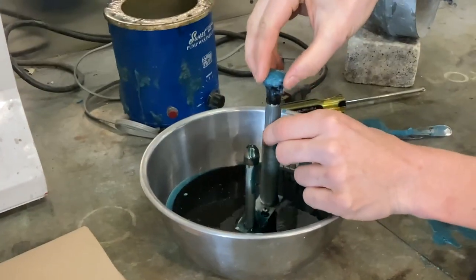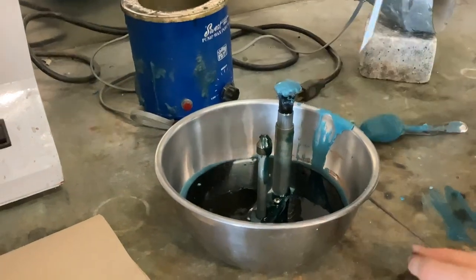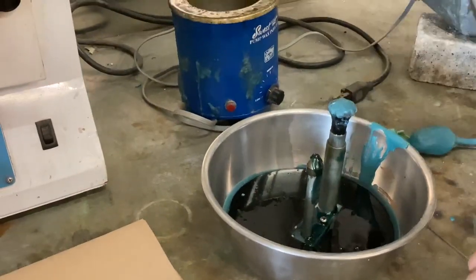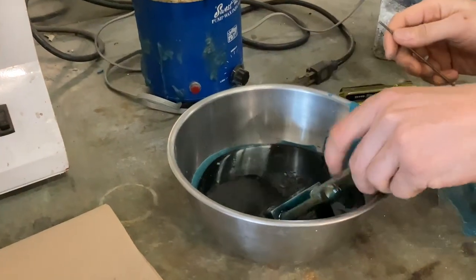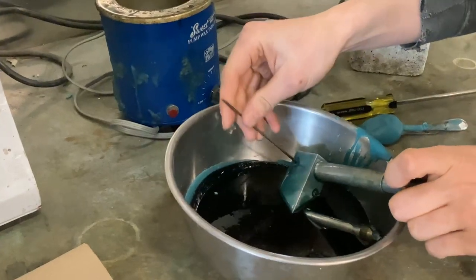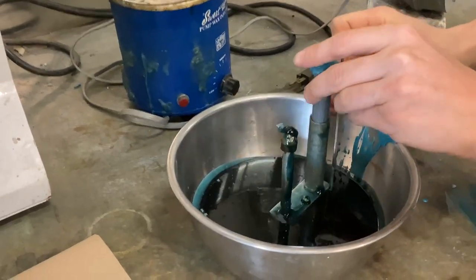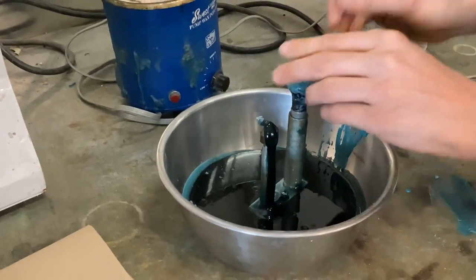We've checked the fluidic line. What happened was we unscrewed this assembly from the bottom of the wax pot and then used a small pick to remove some detritus and hair from the intake port right here. That was what was fouling the line and not giving good clearance flow, and now the wax pot should inject fine.